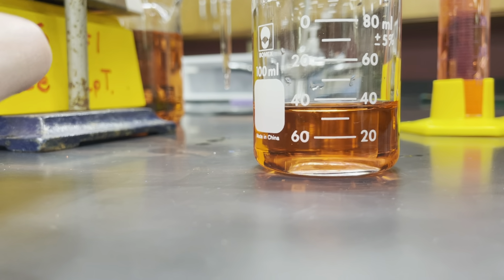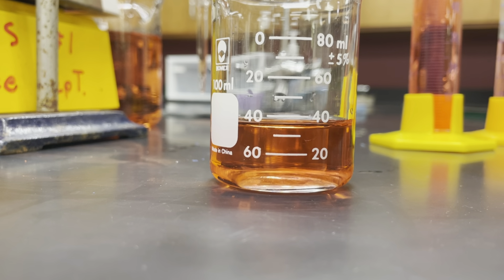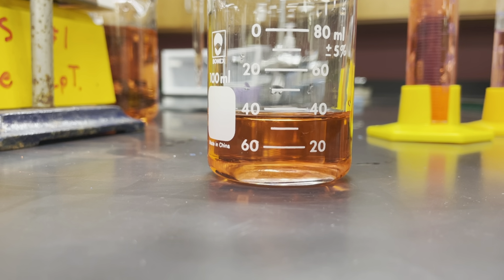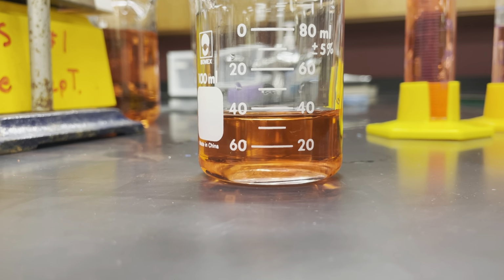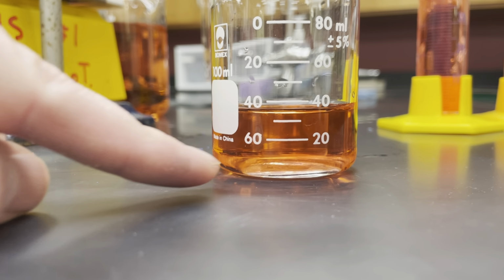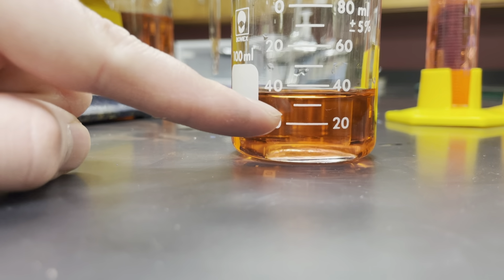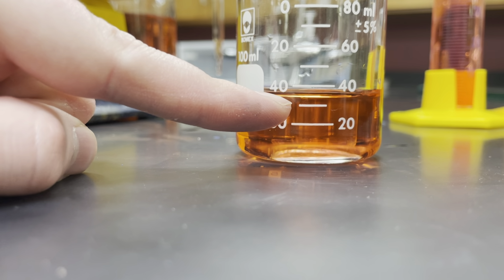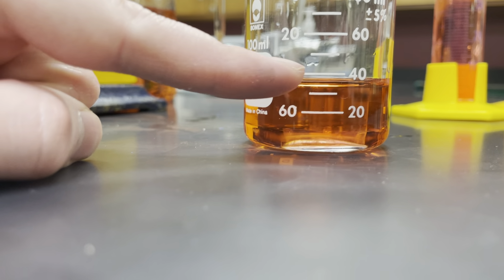We call that the meniscus of the water, and your glassware is going to be calibrated to measure things based on that bottom line of the water, not the top or the middle. Based on our lines here, this is above the 20 line, so it has to be more than 20 milliliters. It's above this 30 line, so it has to be above 30 milliliters, and it's below 40, so it has to be between 30 and 40.